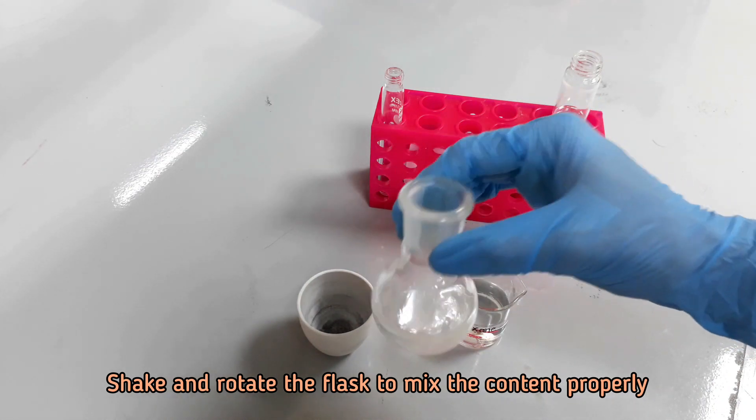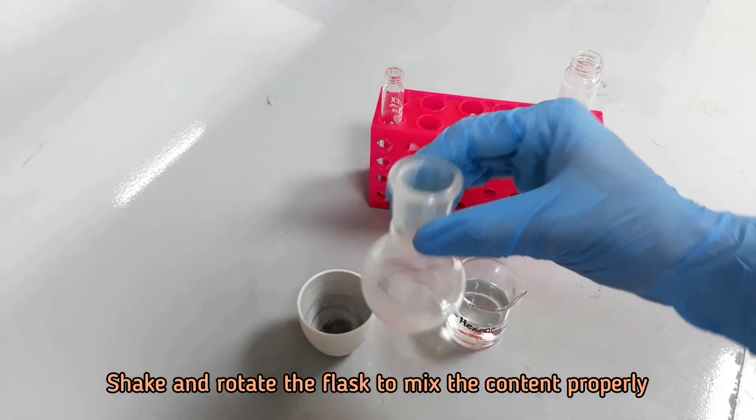Collect the hexane layer as done before and combine with the previous 6 ml of the hexane extract.